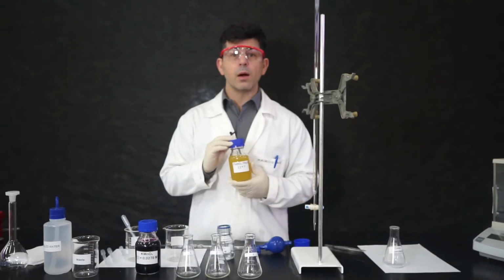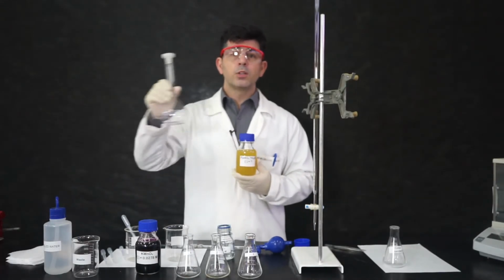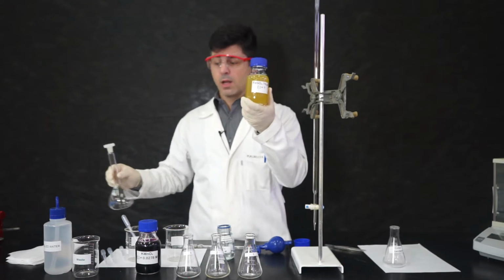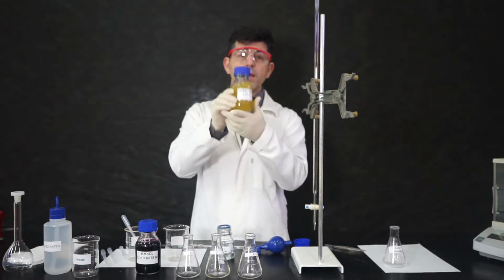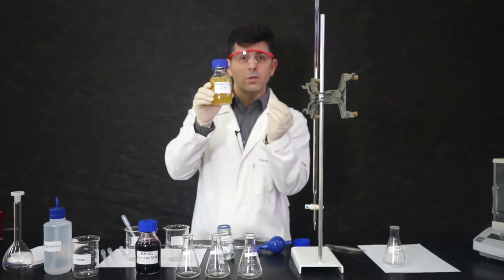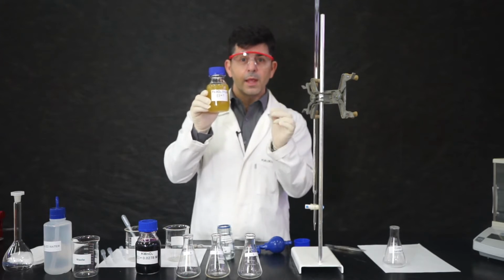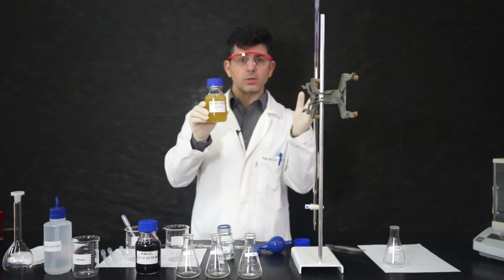So we dissolved that ore in sulfuric acid. We transferred it to a 250 milliliter volumetric flask, and the solution is now in this flask. So all the iron that was in that piece of ore is in here now and has a certain concentration. Remember, we're talking about 250 milliliters of solution. We will analyze this solution through the titration.